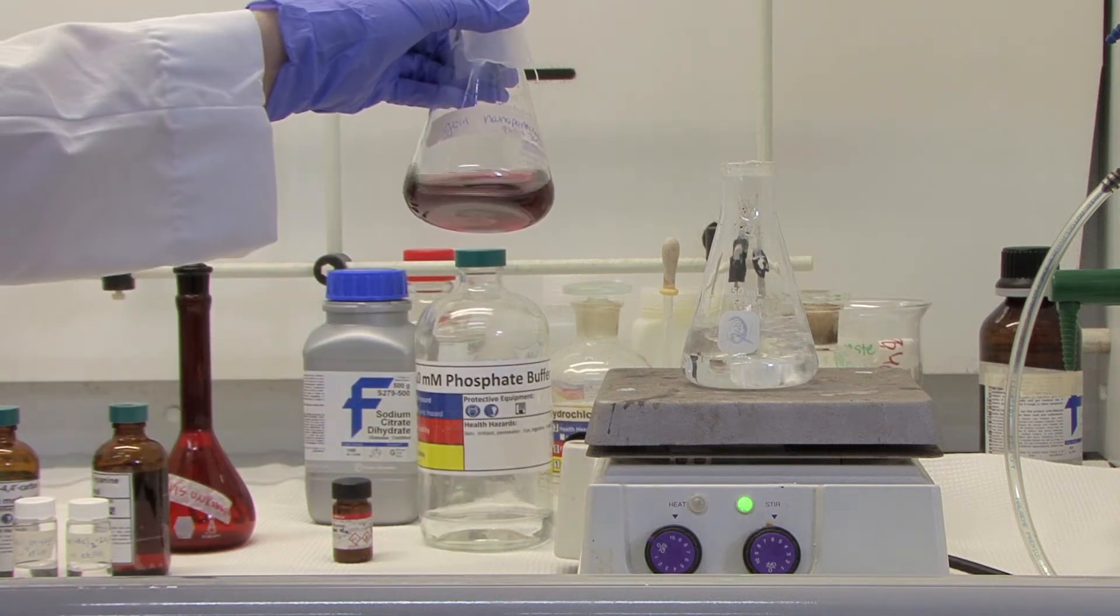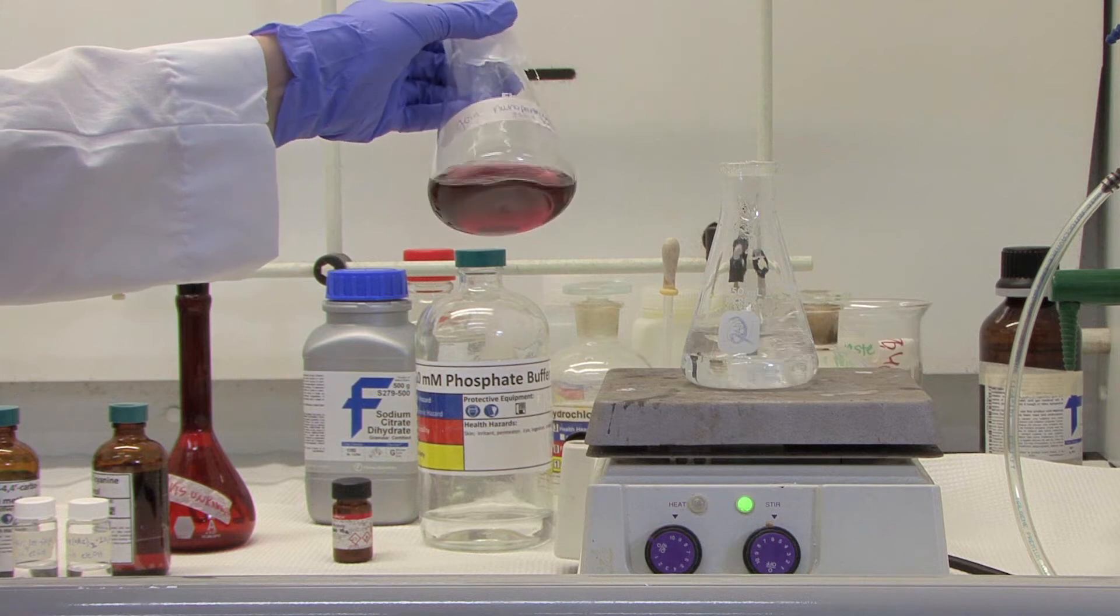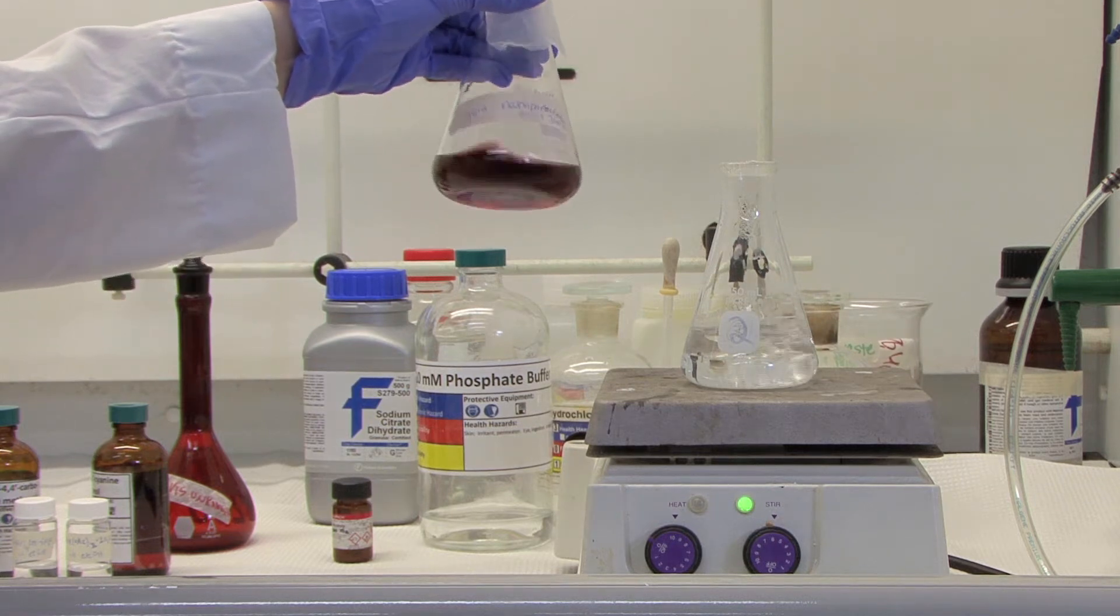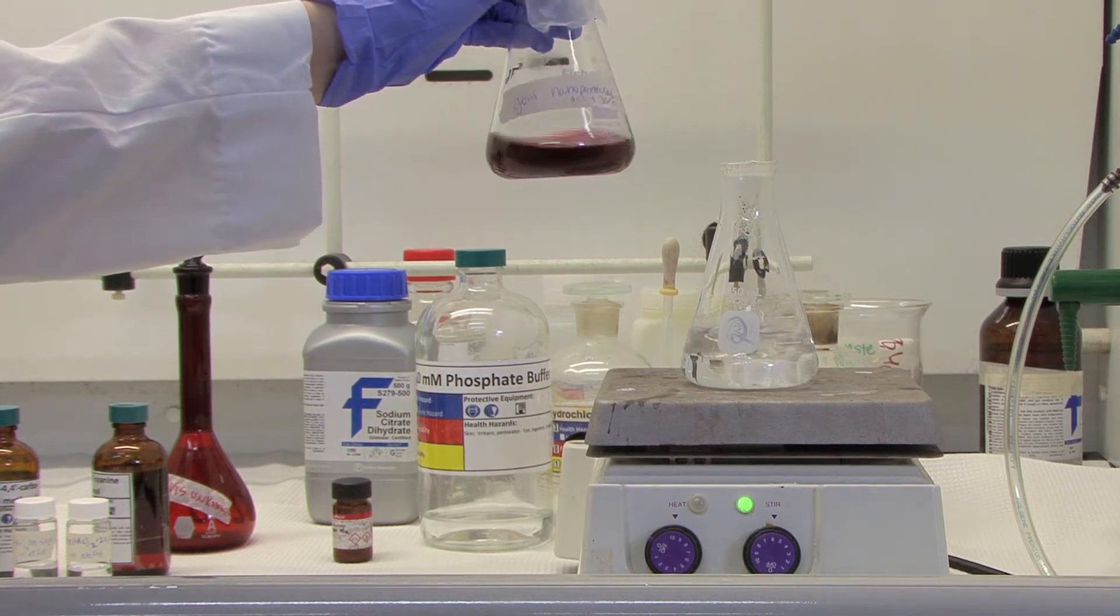This is what your final solution of the gold nanoparticles would look like. It should look like a very deep, rich, wine red.